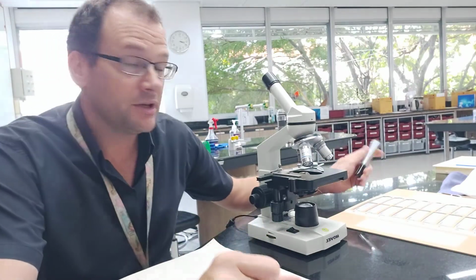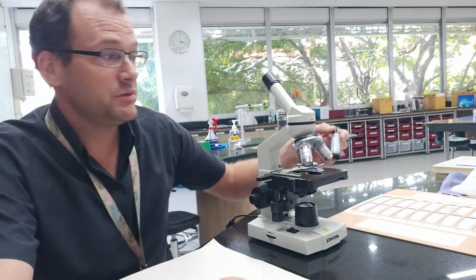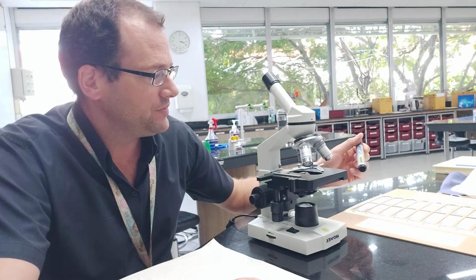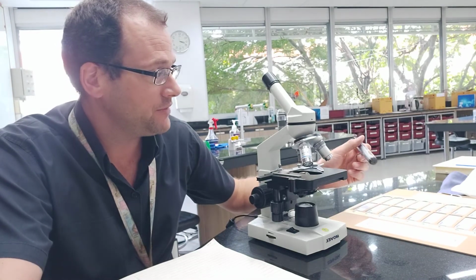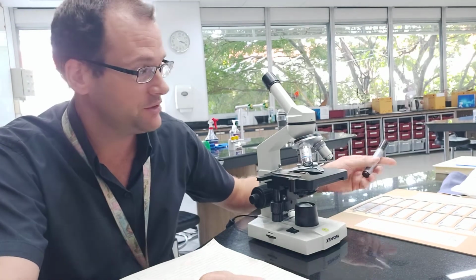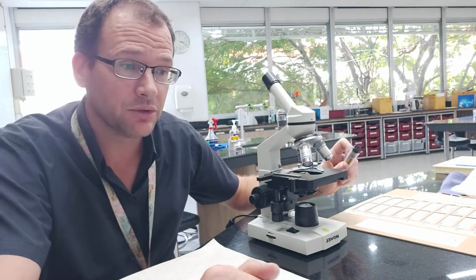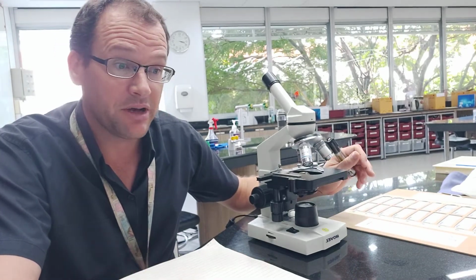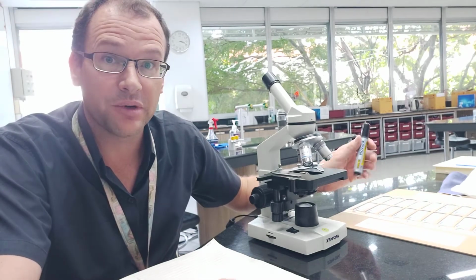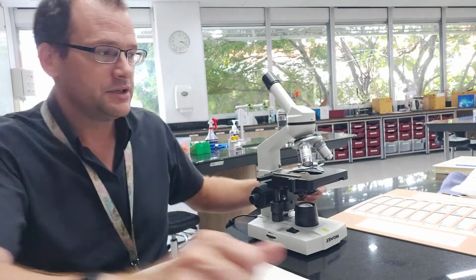Hi Year 8s, just a little video here just to talk you through the microscopes we're going to be using today and over the next couple of lessons. You should be able to have one microscope per person for these lessons. So what we're going to do is go through what the parts of these microscopes are called, maybe a little bit about what they're for, and then the procedure for looking at slides properly under the microscope and be able to focus your image.